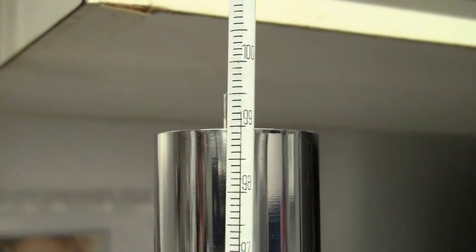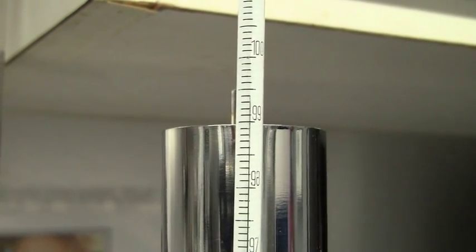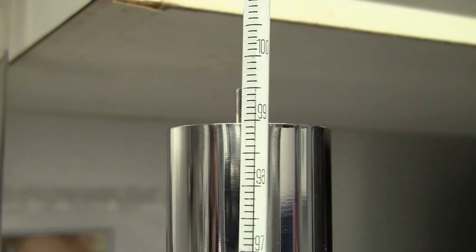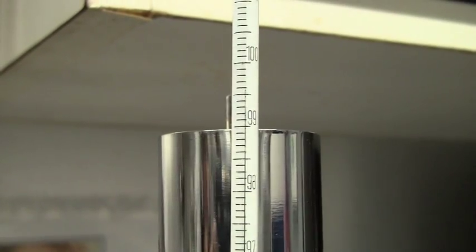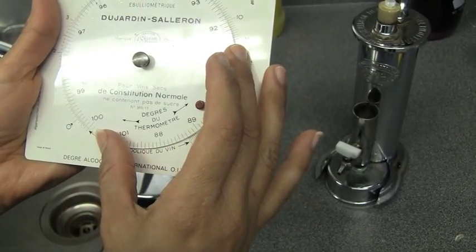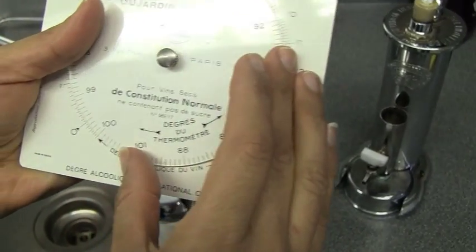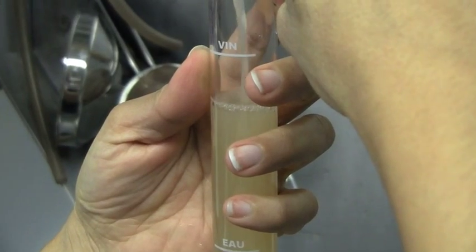99 degrees, 99.1, 99.2, 0.3, 99.4. It's going to hit 100 — I'll tell you right now it's not. You think, well, what's the difference? A few points of degrees in terms of temperature. Well, that ended up at 99.6. So you can see — there's Anna, she's setting it at 99.6. That changes the whole scale.